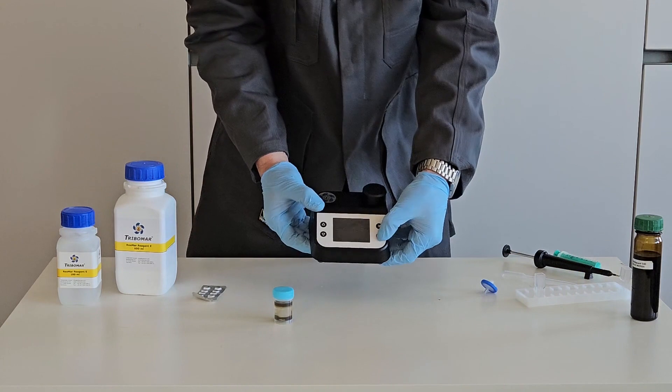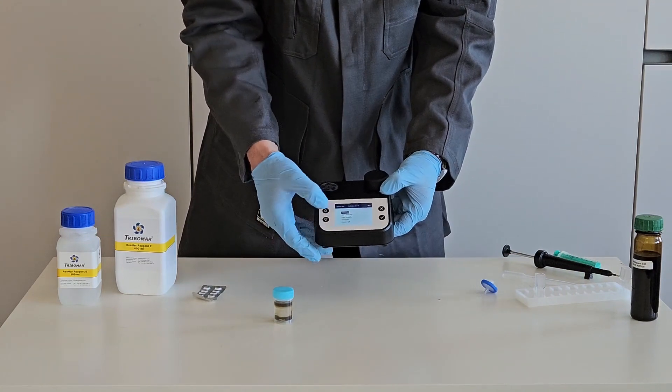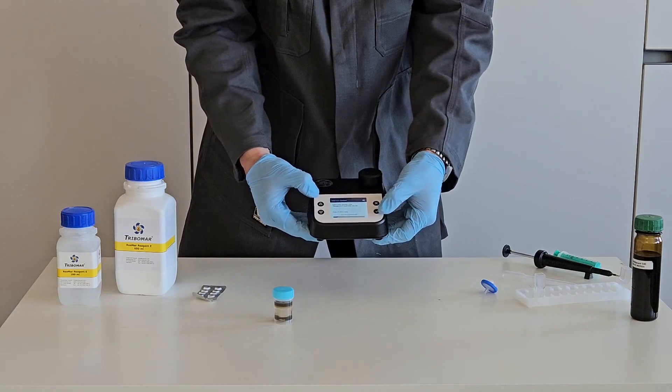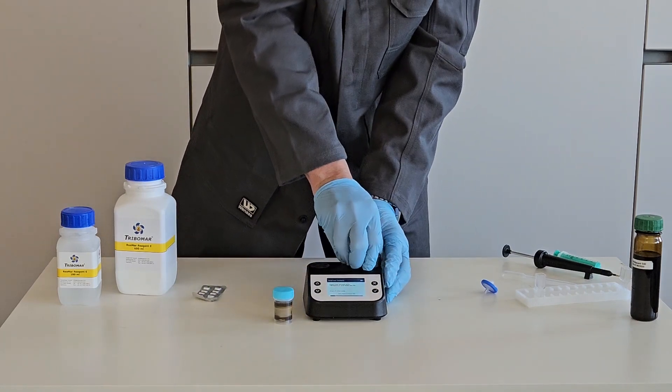Now use the Tribolab 3 and start OK button. It is bottom right. You are led directly to the measure process. Press OK.